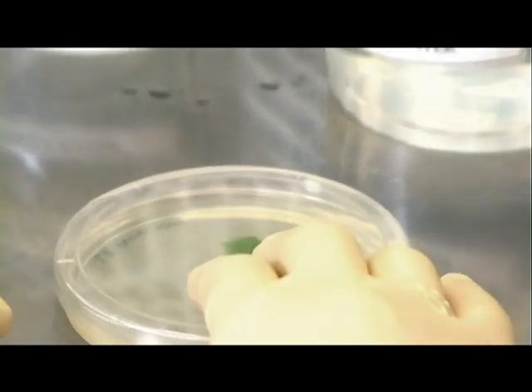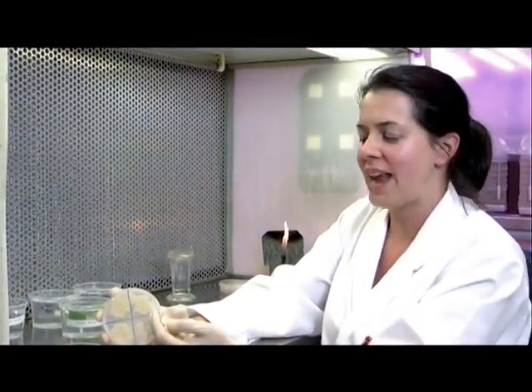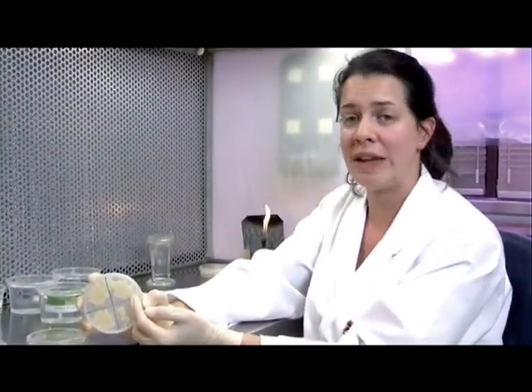Now the hormones that go into the solid media — we have two: auxins and cytokinins. If we had the same amount of auxins and cytokinins, we would generate callus. Callus is a mass of undifferentiated cells and doesn't look green like a plant. We could take this callus and put it onto a new plate containing high levels of auxin and low levels of cytokinin — that would allow it to develop roots. We could then transfer it onto a plate with high cytokinins and low auxins, and that would cause it to make shoots. So we can control the development of that plant depending on the hormones that we choose in our solid media.